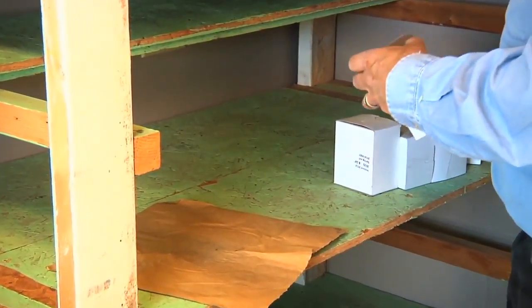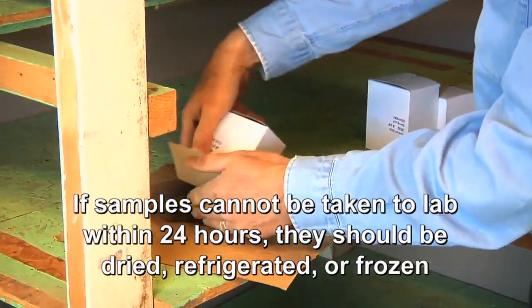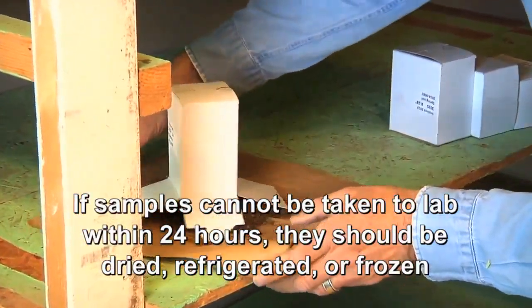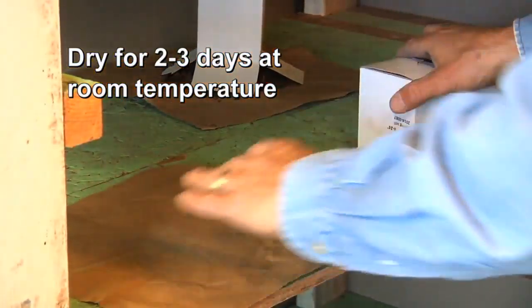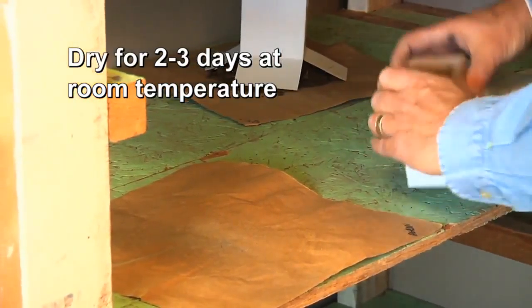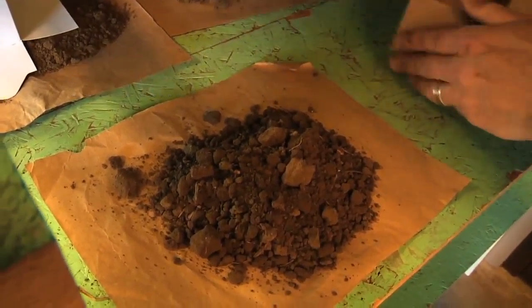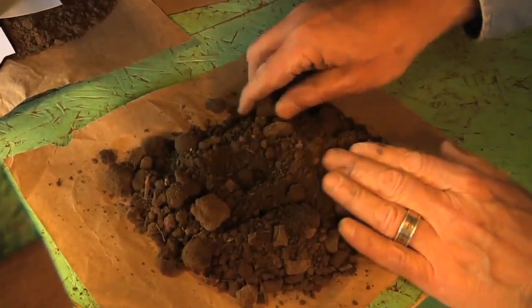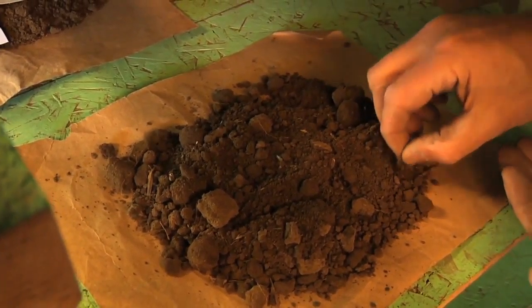If samples cannot be taken to the lab within 24 hours after collection, they should be dried, refrigerated, or frozen. Dry samples by spreading them out to dry at room temperature for 2 or 3 days. Have good air circulation and try to have low humidity. Do not dry samples at high temperature, as this can drive off nitrogen and reduce the analysis.